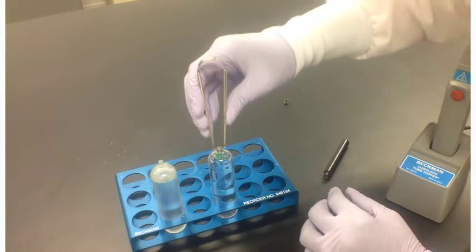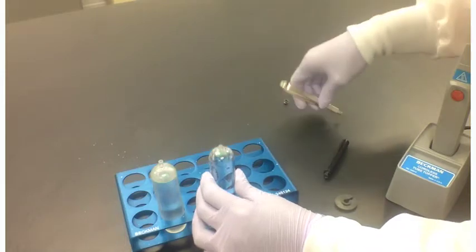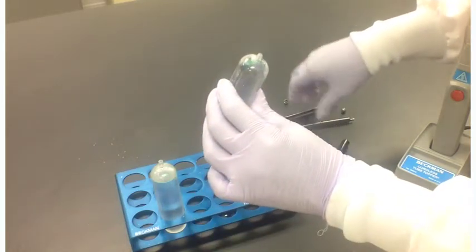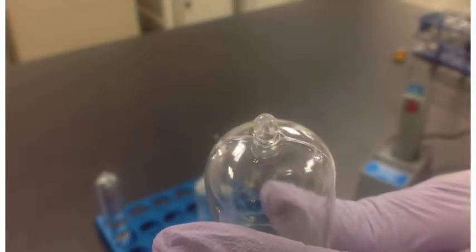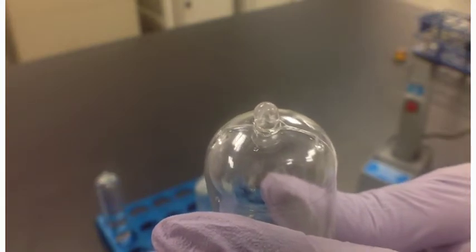Remove the heat sink and seal guide. When the seal former cools, remove it by hand or with the removal tool 361668. Save the seal guide and former for future use.